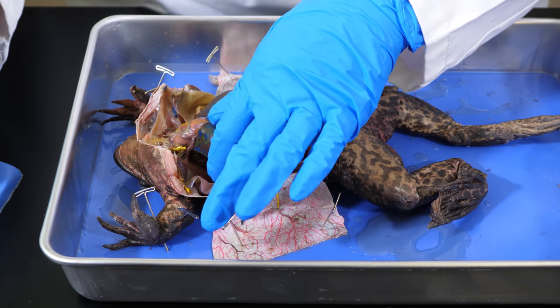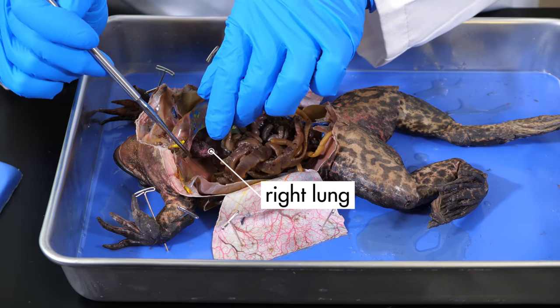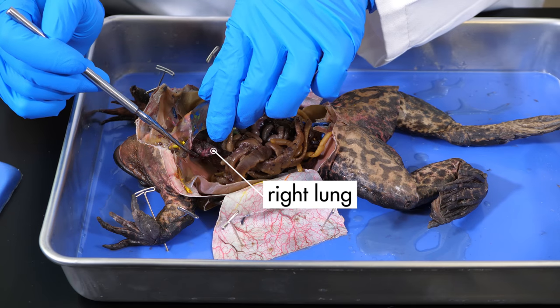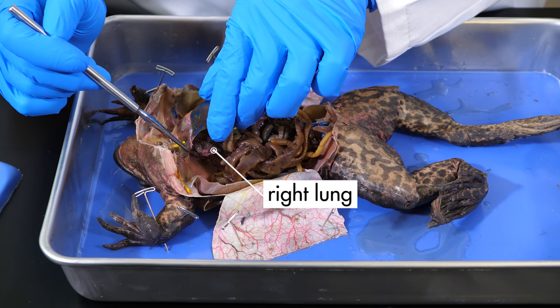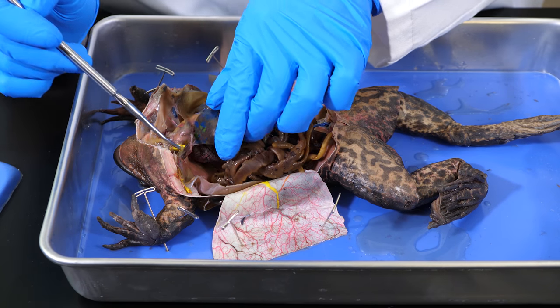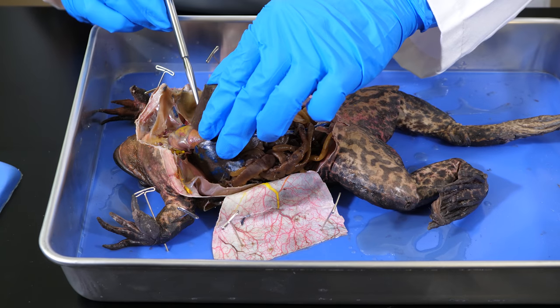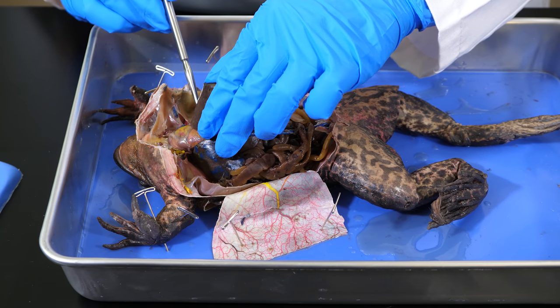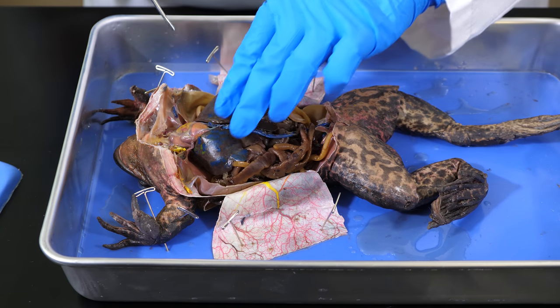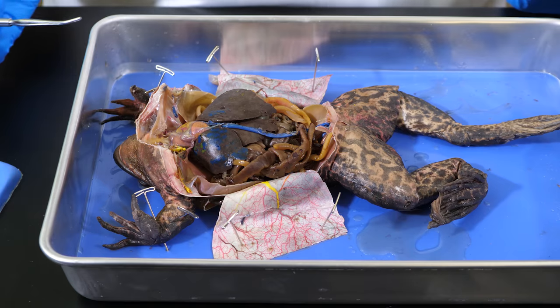To see the right lung, we need to lift up the lobes of the liver. The left lung is over here, but we cannot see it because it is hidden beneath the liver.